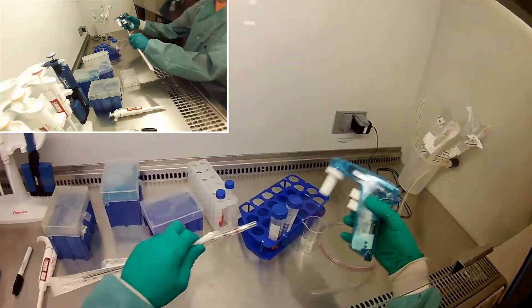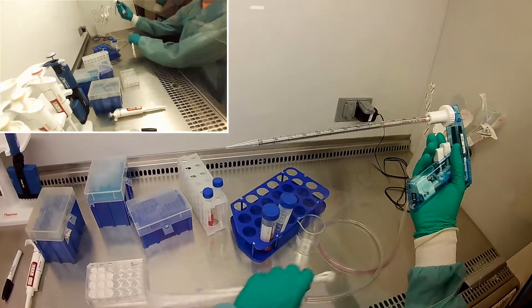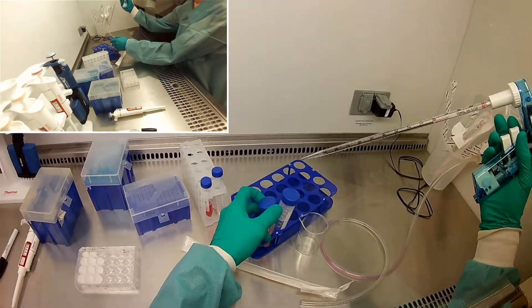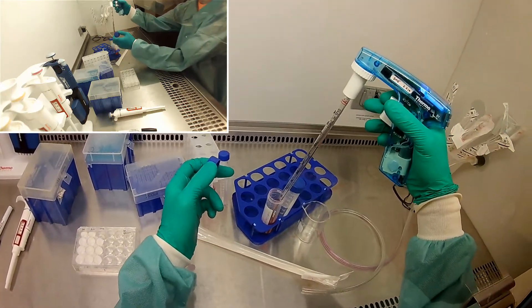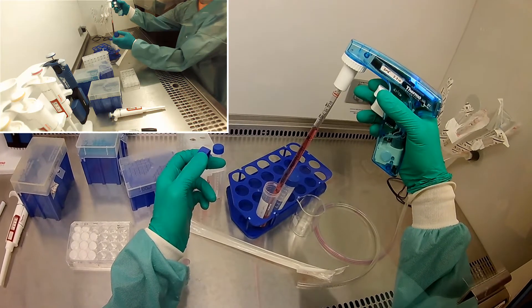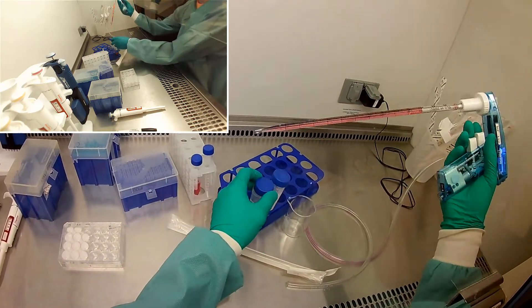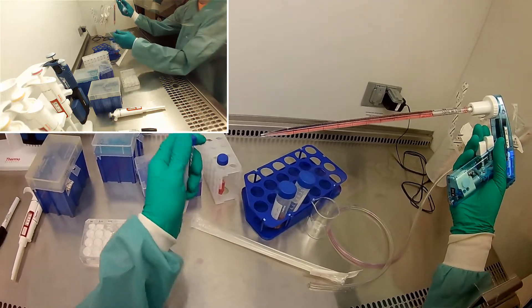So I'm going to get the media first. Usually you would do the media first in this instance because then you put the cells into the media. I'm going to get 11. I'm going to try to be pretty exact on this, as exact as the serological pipetter will allow.